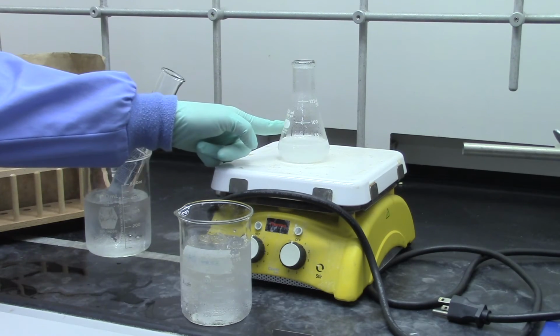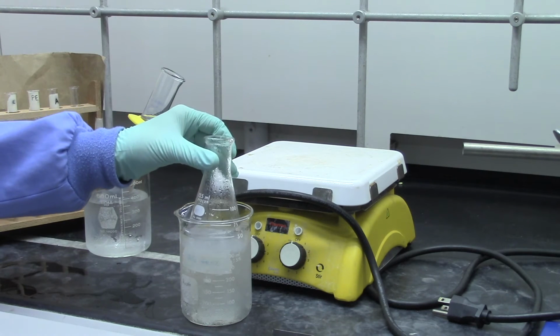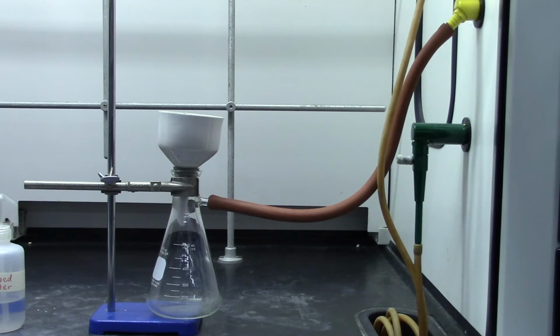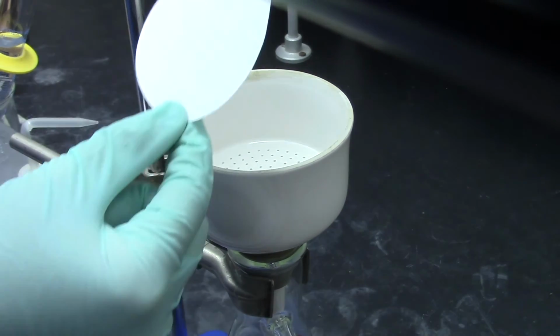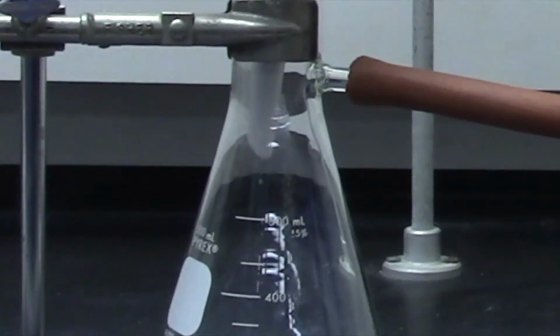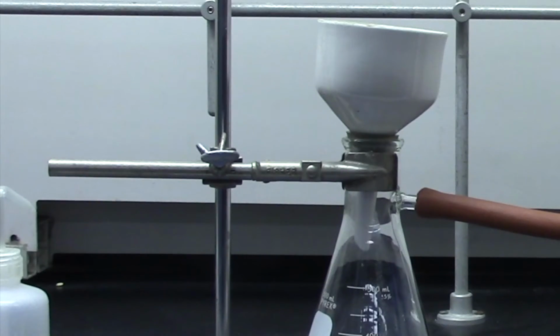Once at room temperature, check by touching, place the flask in an ice bath and keep for 10 minutes. While waiting for product to form, you can prepare for the next step by setting up your filtration system: a Buchner funnel with pre-weighed filter paper, rubber adapter, and a filtration flask, as well as chilling 100 milliliters of water in an ice bath. Fix the filtration flask on a ring stand to prevent accidental flipovers.